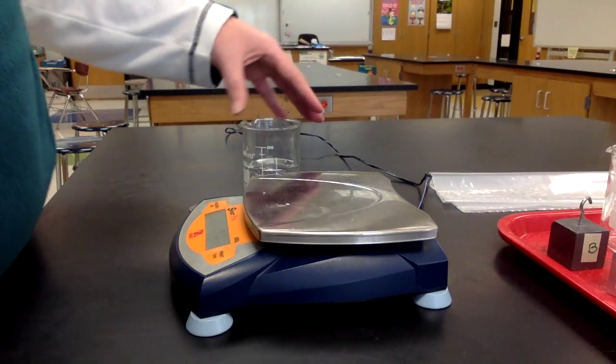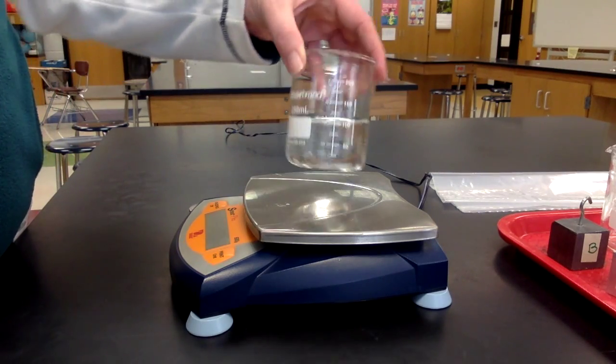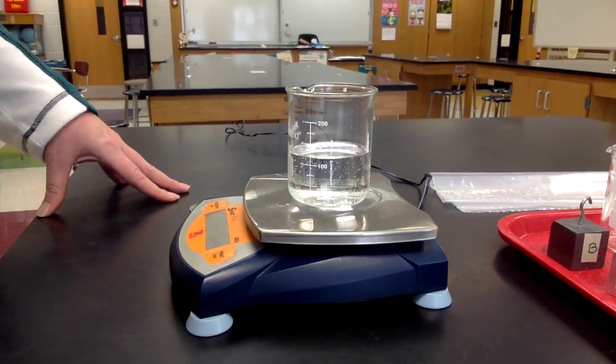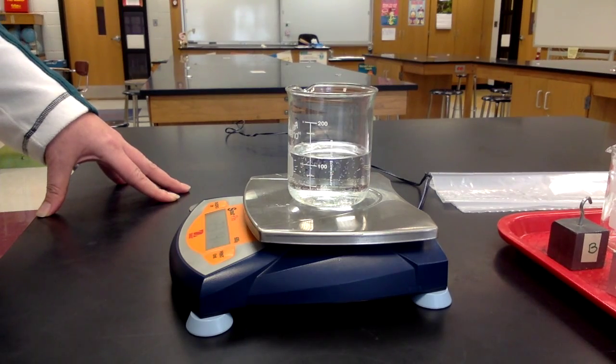Now, record the mass of the container with the liquid. Record that number.